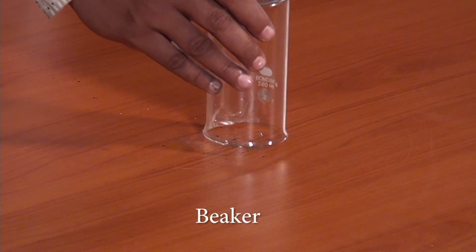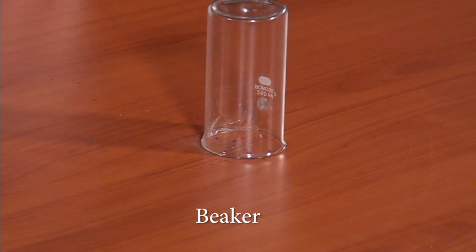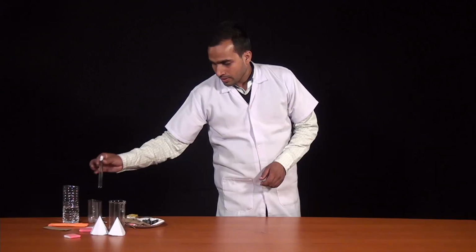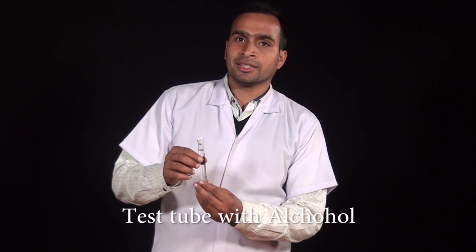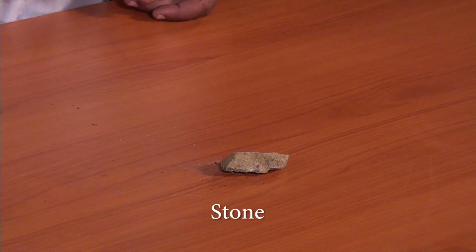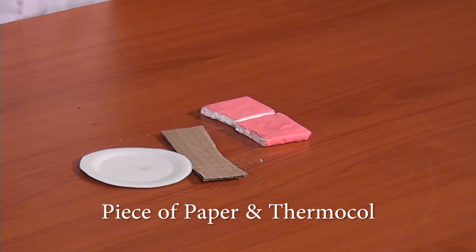You can bring this beaker from our science laboratory with proper permission. You can see a liquid inside the test tube. This liquid is alcohol, and when you use this alcohol, you should be very careful. You can collect this alcohol from your science laboratory. This is a stone, which is easily available. For conducting certain activities you have to bring this stone. We have also collected certain materials such as a piece of paper and thermocol. These are very common materials, and you can find them in your surroundings.